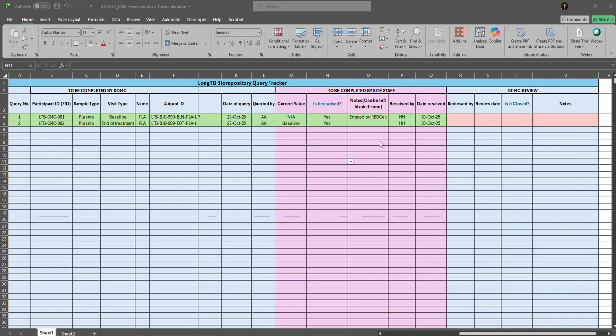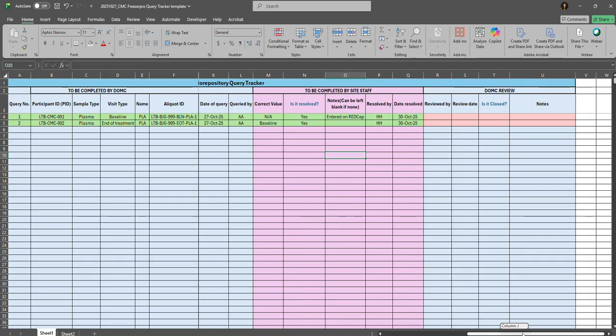Once the site responds to the queries, the rows will turn green in the to be completed by site staff section, as seen here. And then it will go to DOMC review. DOMC will review the site responses bi-weekly and update their review comments in the DOMC review section by adding their initials and the date of the review. Suppose they have reviewed on 25th November 2025, they will add that here, and respond to the is it closed field as yes, if they consider the query resolved.